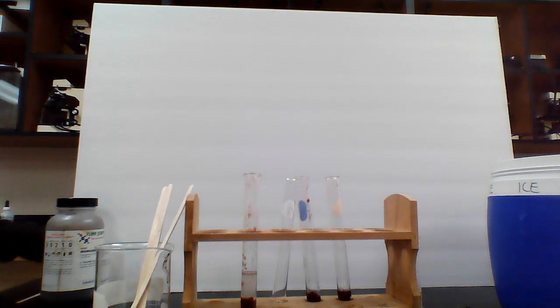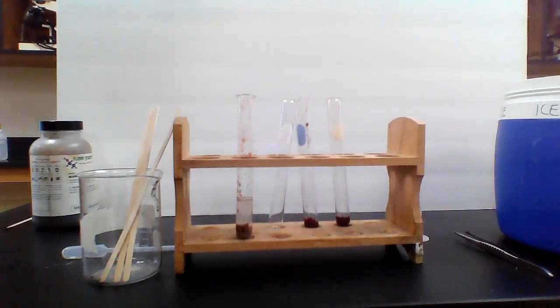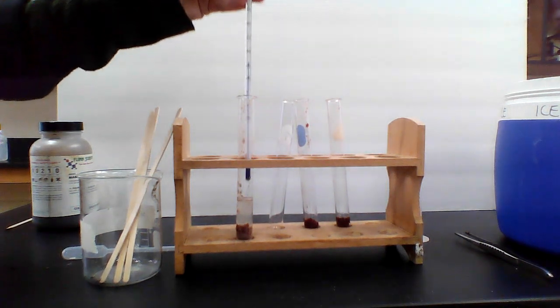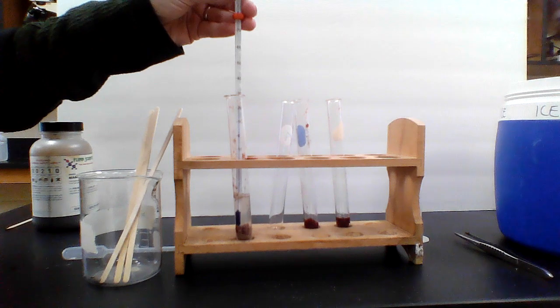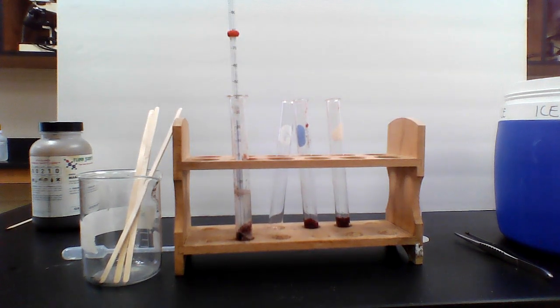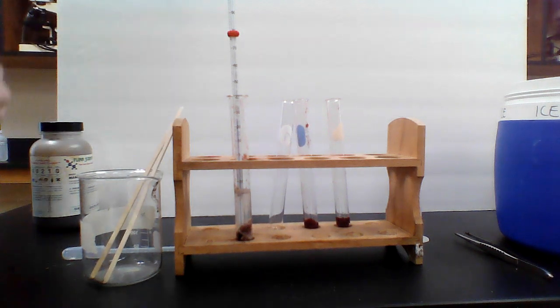Ooh, KJ, that's interesting. Pretty much nothing's happening. Lower it a little bit, bring it close to make sure you can see. I don't see anything going on with the acid at all. Maybe a tiny bit. Could we give it a 1 for bubbling? So really, really small amount of bubbling. There we go, a little bit of bubbling there. And I'll give it just a moment for the temperature, and then we'll do a splint test again. Get a new splint. That splint was wet.